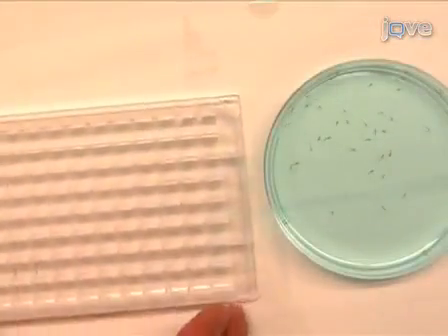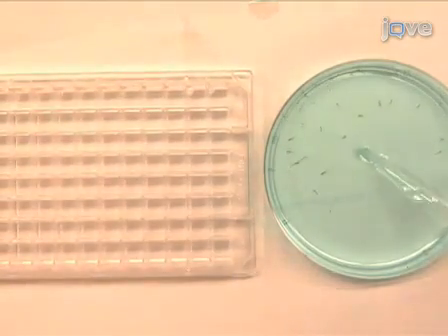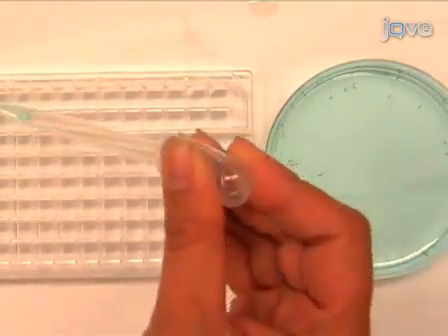After five days post fertilization we transfer zebrafish to a 96 well plate with six hundred and fifty microliter well size in order to give larvae large swimming room, using a plastic transfer pipette.